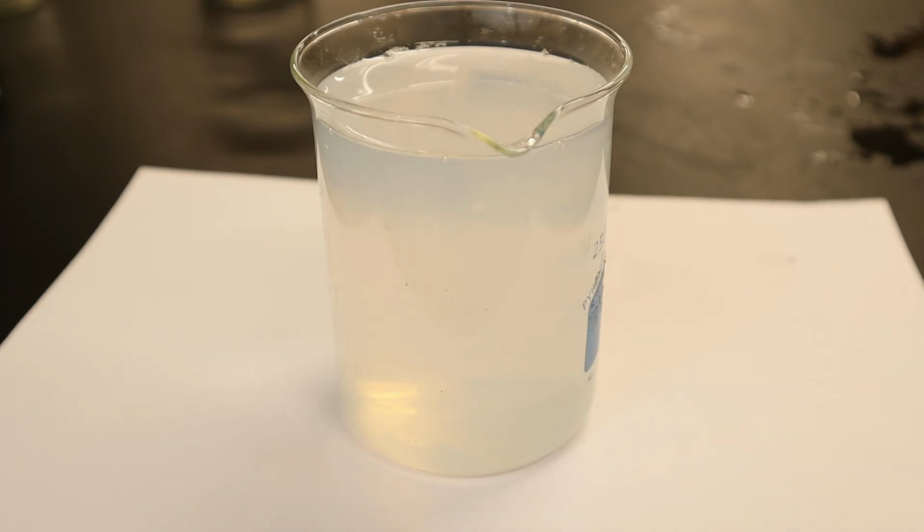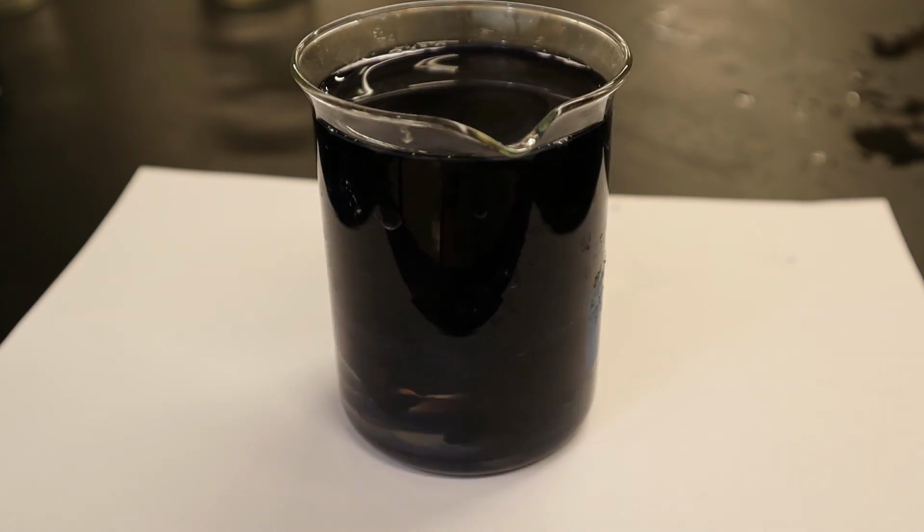What happened? Maybe it's broken. Maybe this one's not going to work. I don't know. Maybe something's wrong with it. What's happening here? This is really strange. I fooled you. Yep, that one was longer. Why? Because it had a lower concentration, so it took longer.